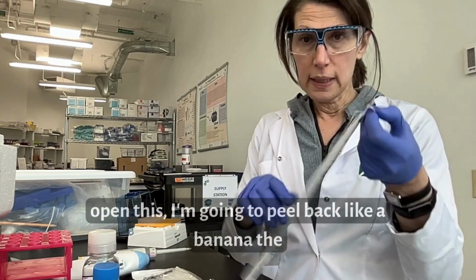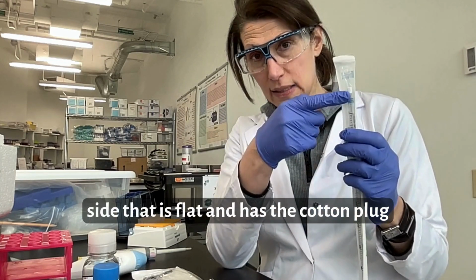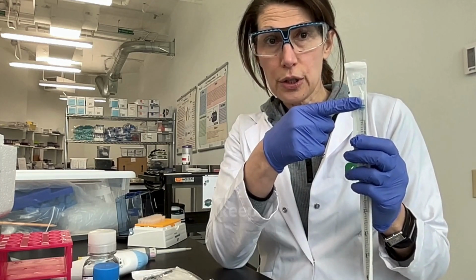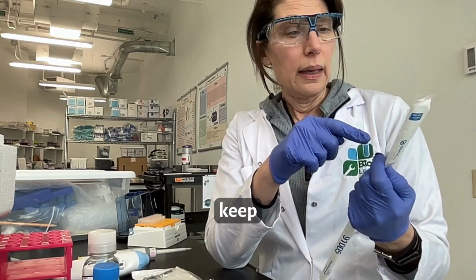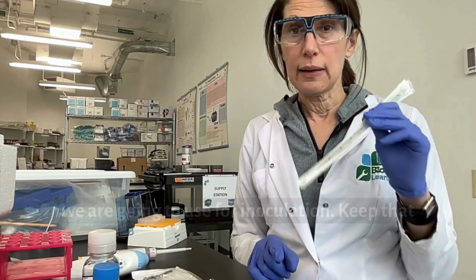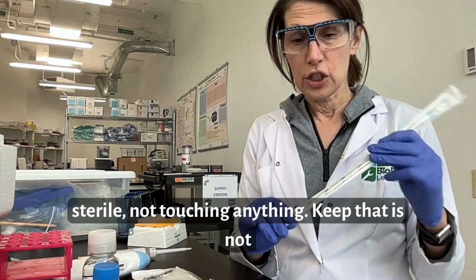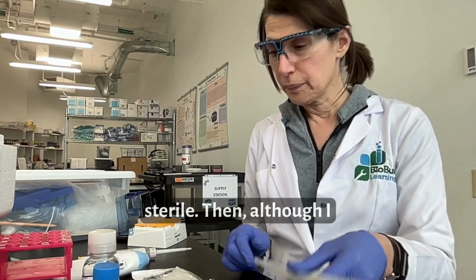Again, to open this, I'm going to peel back, like a banana, the side that is flat and has the cotton plug in order to keep the end that is sterile, the pointy end here that we are going to use for inoculation, sterile, not touching anything that is not sterile.